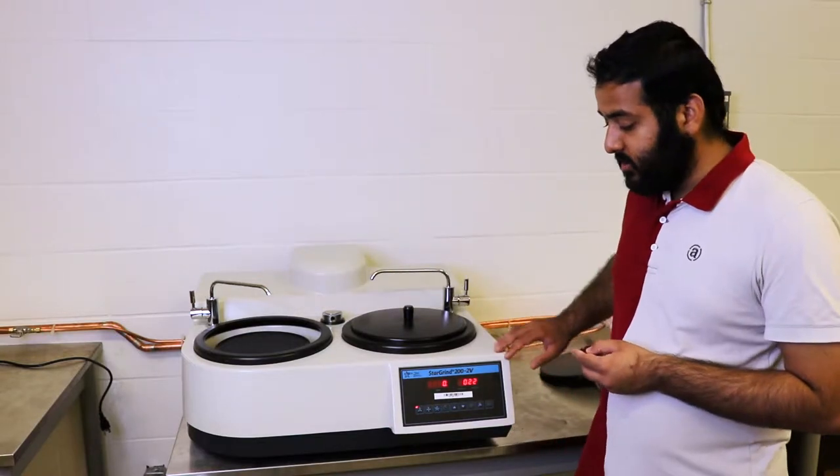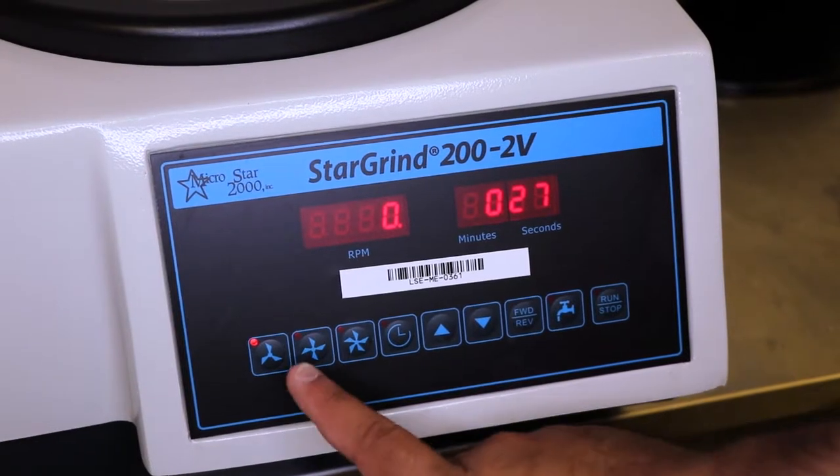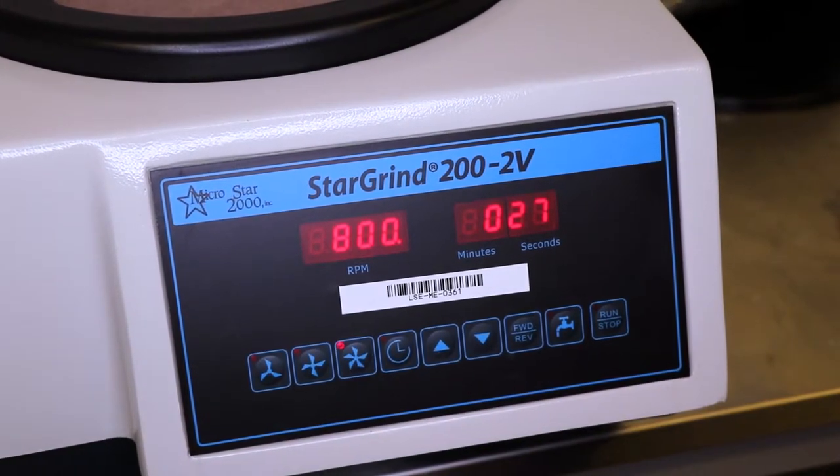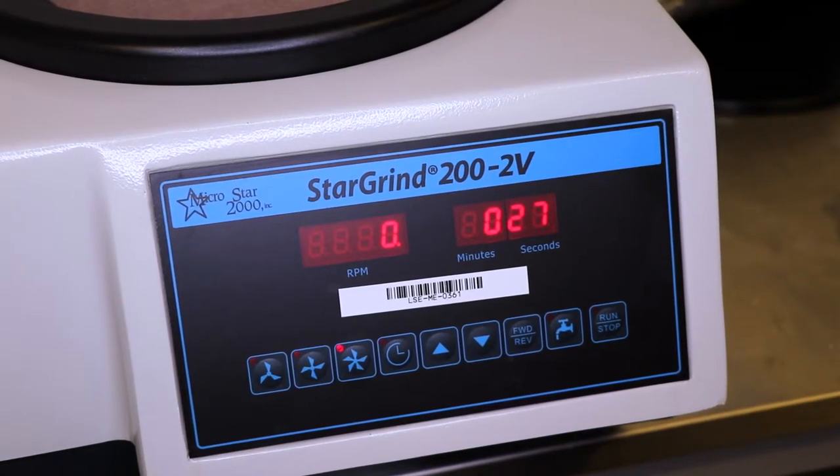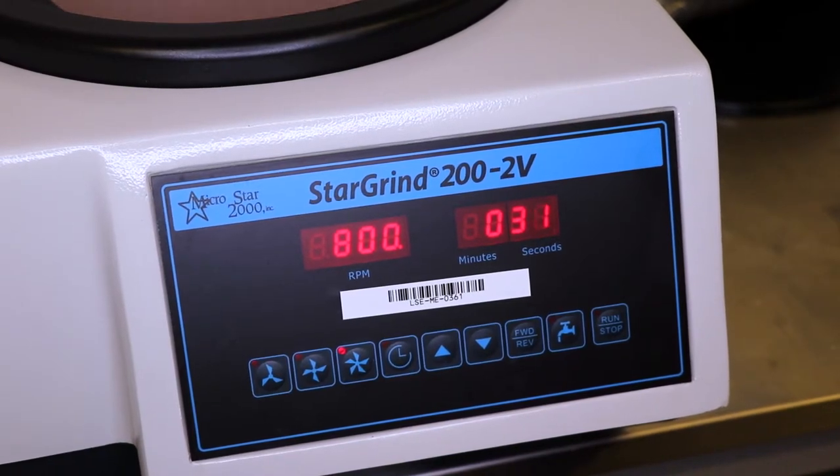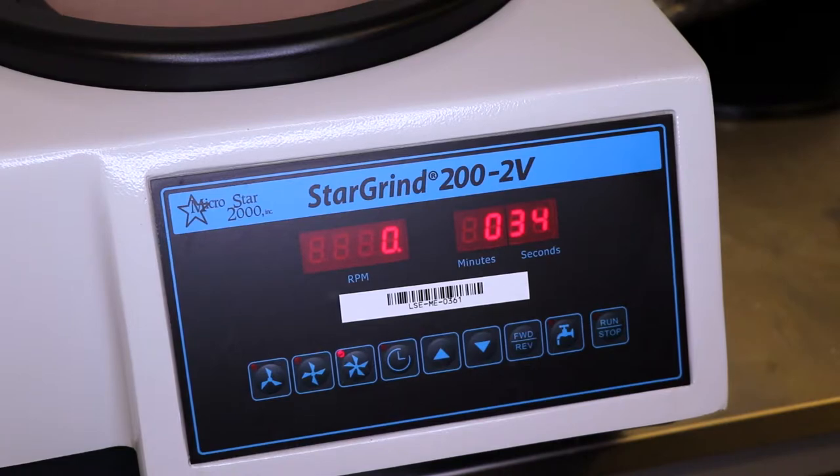You use the console below and you can select a pre-selected speed which is 300, 500, and 800. Once you've selected your appropriate speed, you click run once to get the machine to start, and you can press that same button to get the machine to stop. There are other buttons on the machine, but you don't have to worry about them yet.